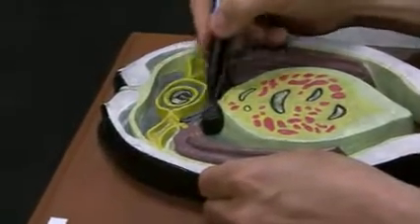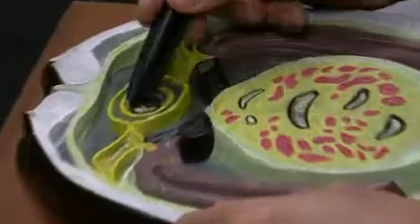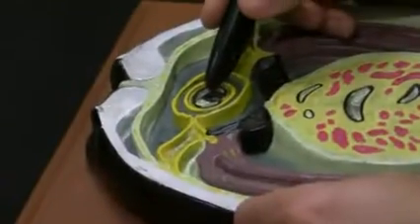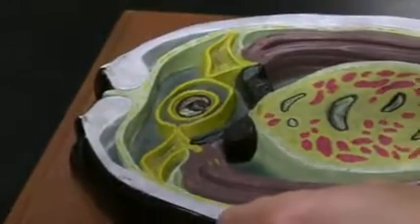Heart, typhlosole. This is intestine. The brown is intestine, and typhlosole is passing right through. And this is the coelom, pericardium. Of course, heart is here. And as I said, these are strange animals. Intestine passes right in the middle of the heart.